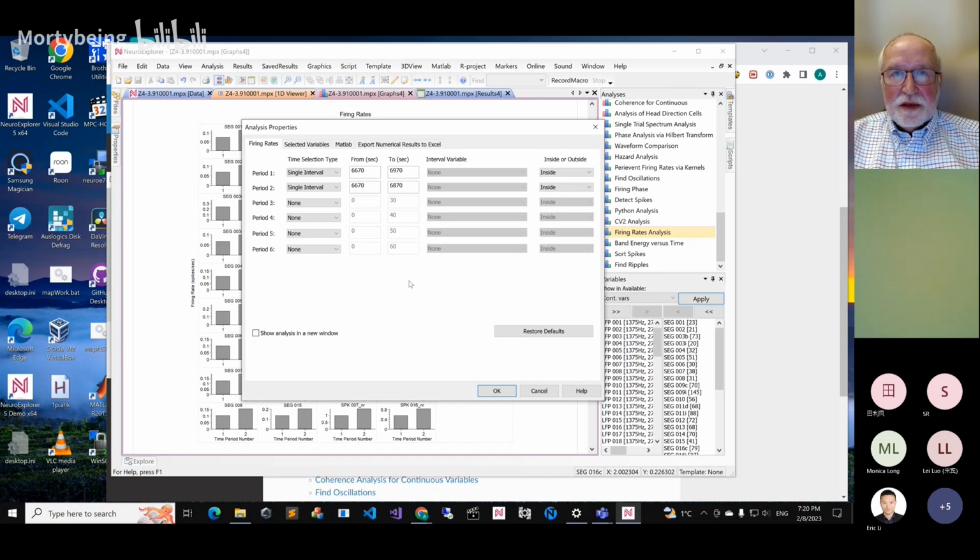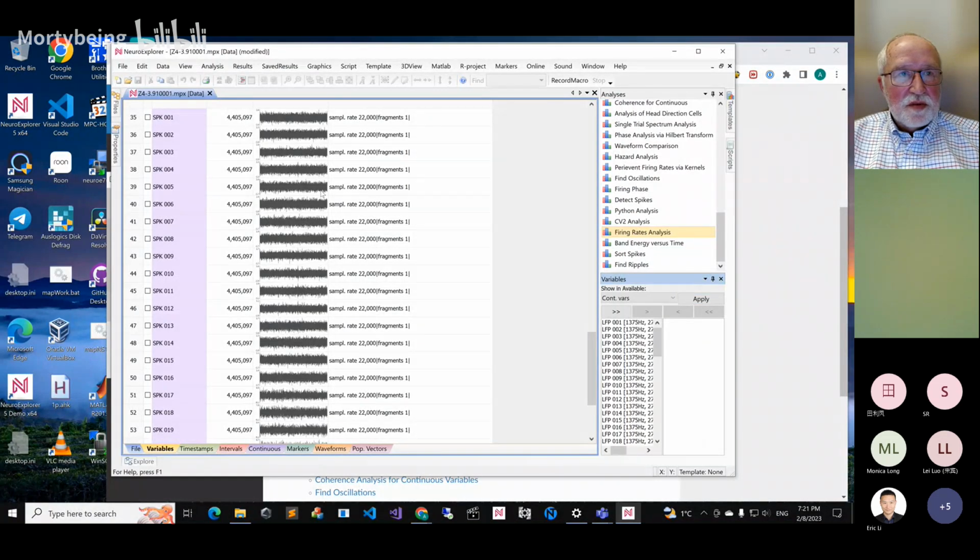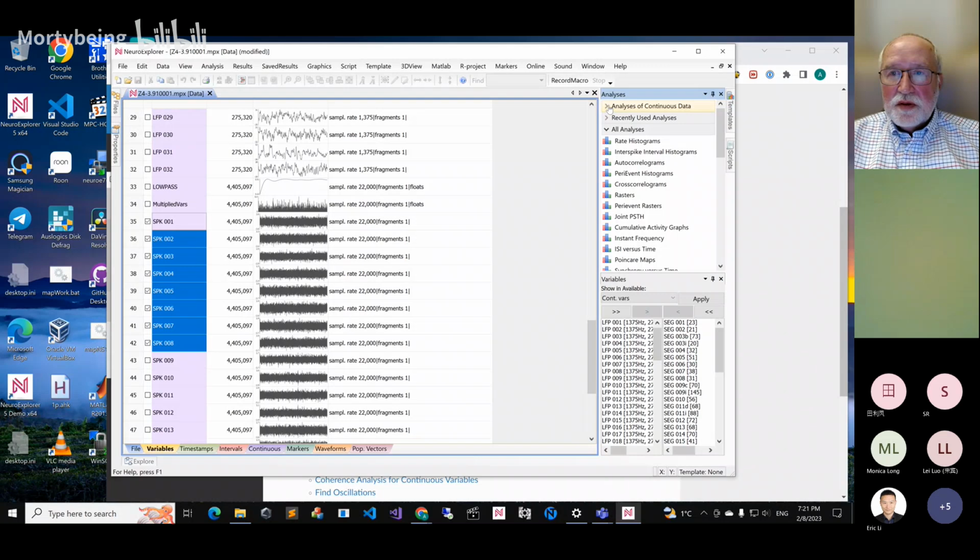Okay, Alex. So the next one was spectrum analysis. Do we need to do anything with spectrum, or did we already look at it? Maybe you can show it again. Okay, so let's select some of the spike channels, and then we go to analysis of continuous data, then we go to power spectra.